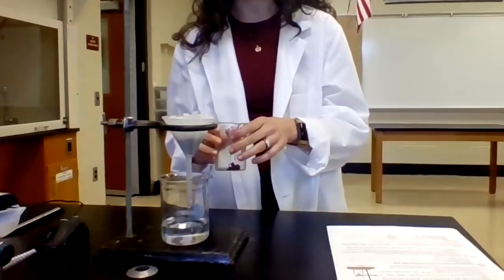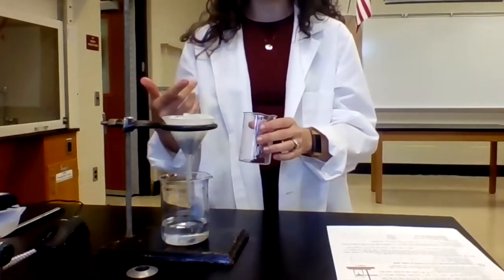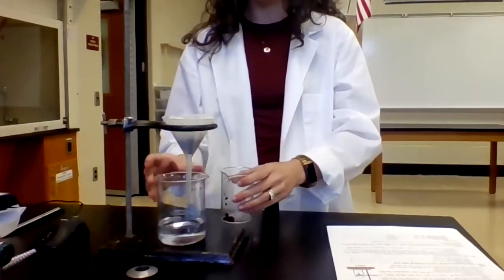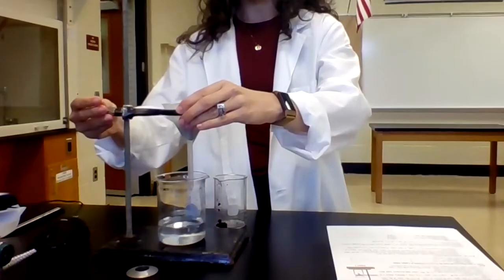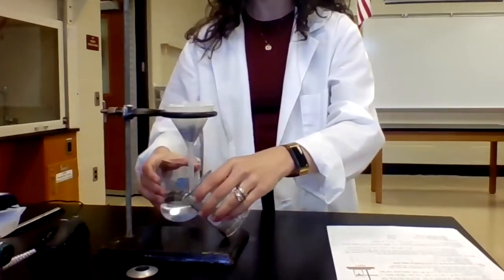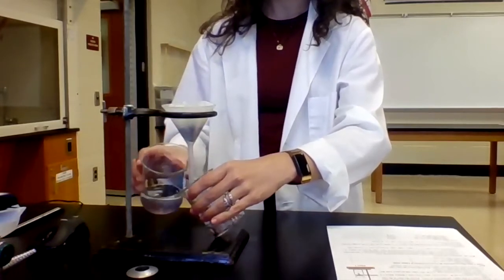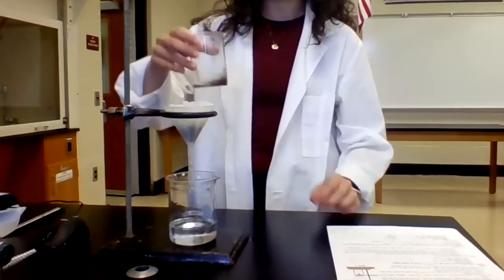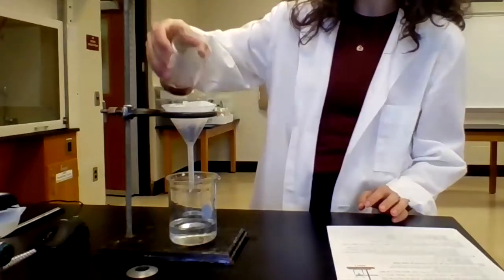So like I said, I'm going to let this drain a bit. And then I'm going to do this one more time, possibly another time. We'll see how it looks. And I can even raise this up just a little, make this a little bit easier. Okay. And so I really want to get some momentum as I stir it.